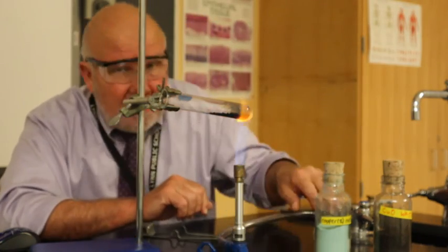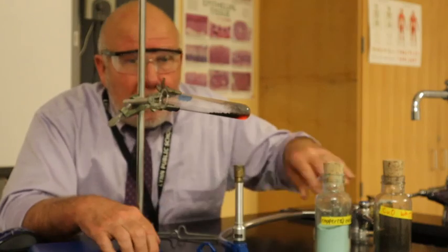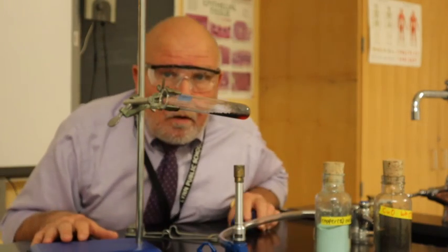All right, so I'm going to shut the gas off here. I'm going to let it cool down, and we'll resume later.